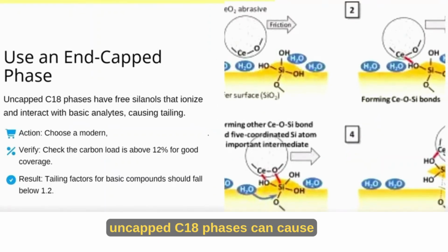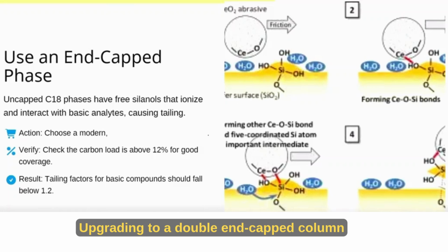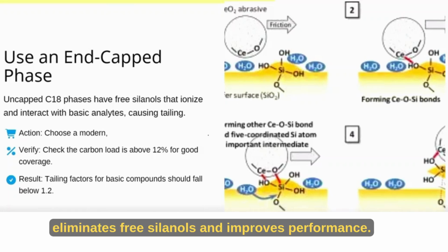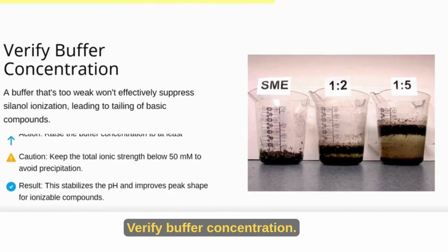Use an end-capped phase. Older, uncapped C18 phases can cause serious tailing. Upgrading to a double end-capped column eliminates free silanols and improves performance. Always check the carbon load. More than 12% means better coverage.